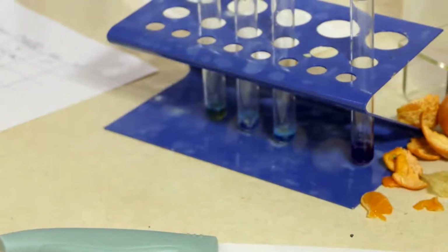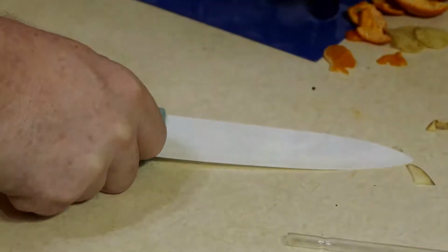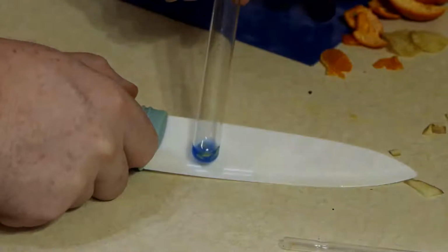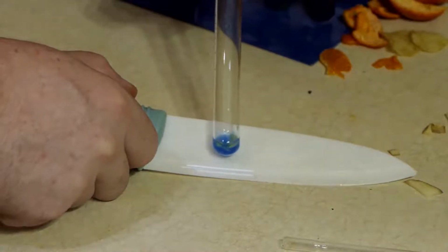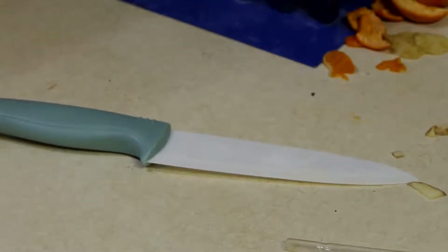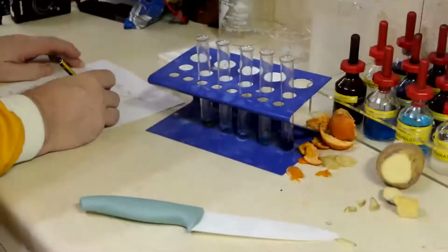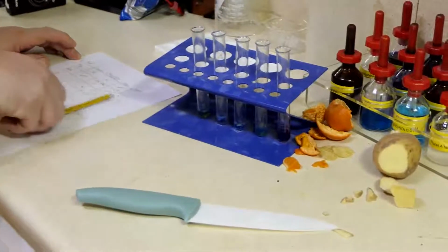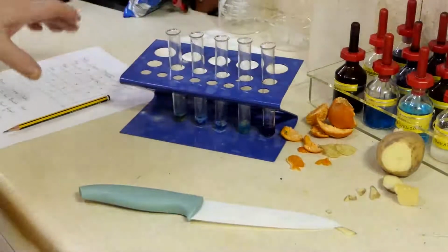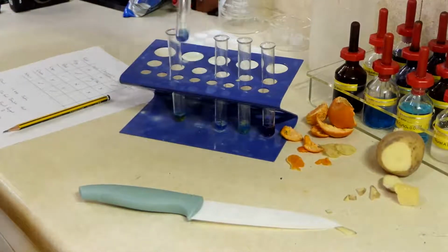My potato looks largely unconvincing here, with no purple I can see in there. My crisps, boring, the same, no protein in there. Now I'm not really surprised those two are following suit, because let's face it, crisps are made from potato.